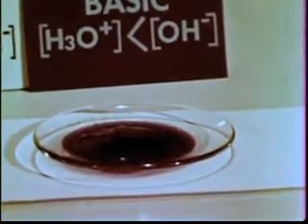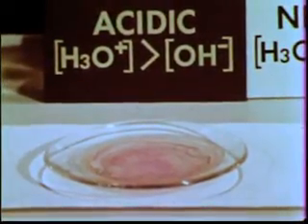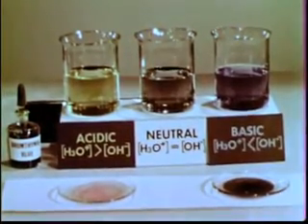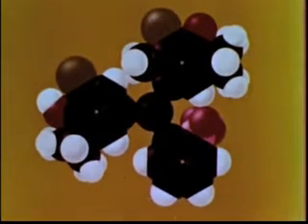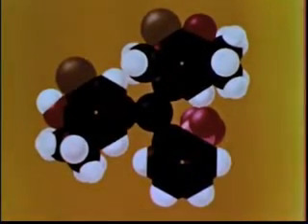If we evaporate the blue solution, we obtain this solid. This solid is obtained by evaporating the yellow acidic solution. What accounts for the color changes of the indicator in these solutions? Analysis of the blue substance shows that its color is due to blue negative ions with this structure. Analysis of the yellow substance shows that its color is due to yellow ions with this structure. The only difference between the yellow ion and the blue ion is the presence of a proton here in the yellow ion.